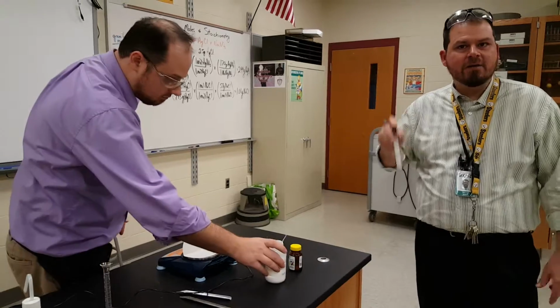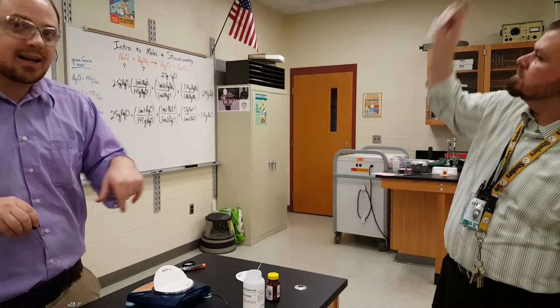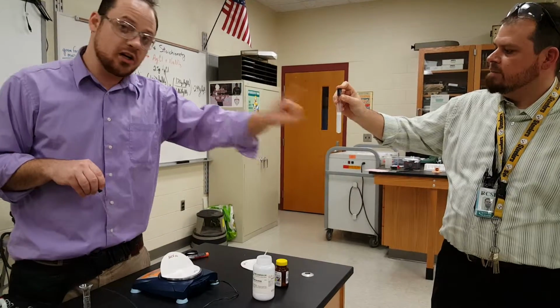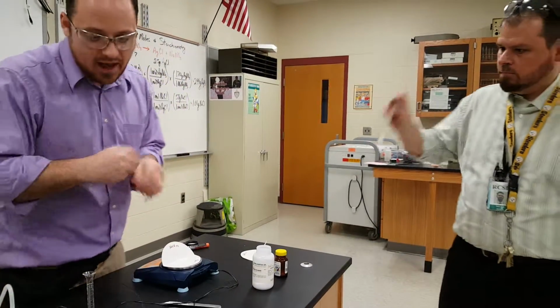So for that reason, it's a precious metal, and the chemical itself is rather expensive. Now, the limiting reactant: we want to use up all the silver nitrate and turn it into silver chloride. So we want this to all be used up, so we add a little extra of the other ingredient so that it does.